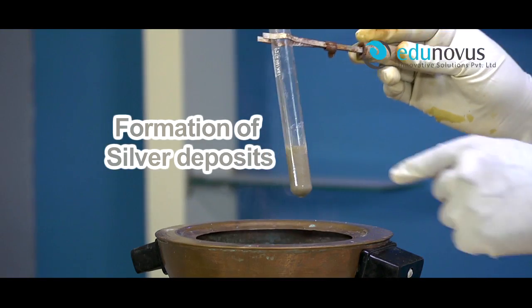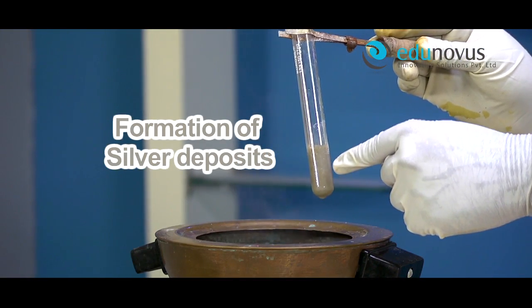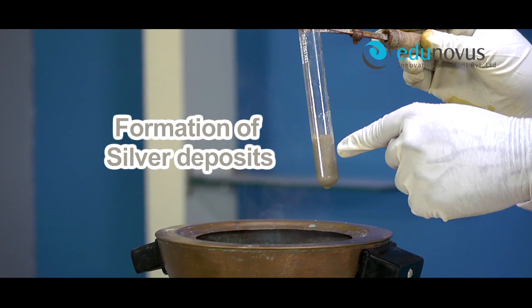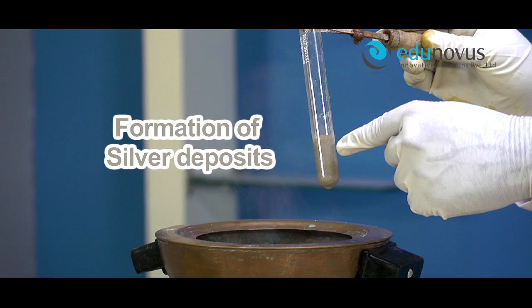Heat the reaction mixture on a water bath for 5 minutes. After 5 minutes, formation of silver deposits on the inner side of the test tube indicates the presence of carbohydrates in the given food compound.